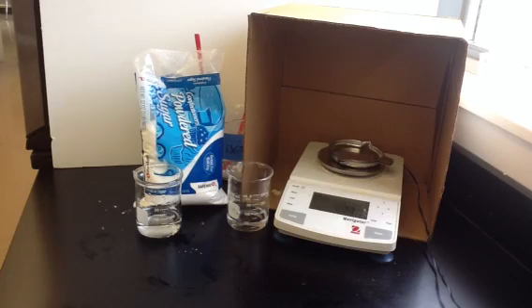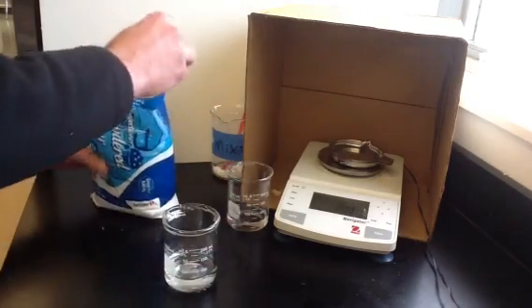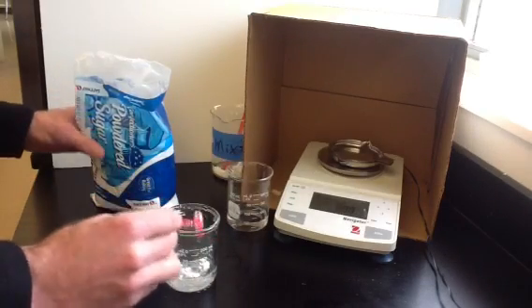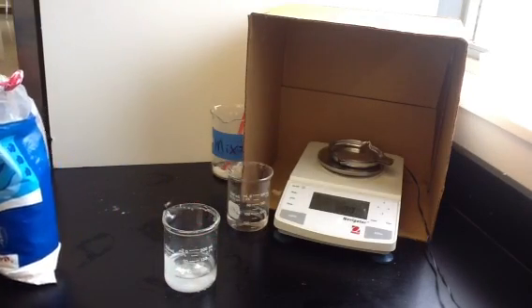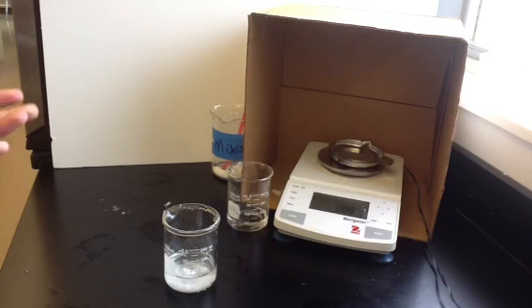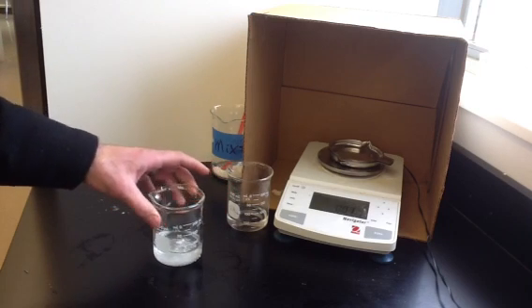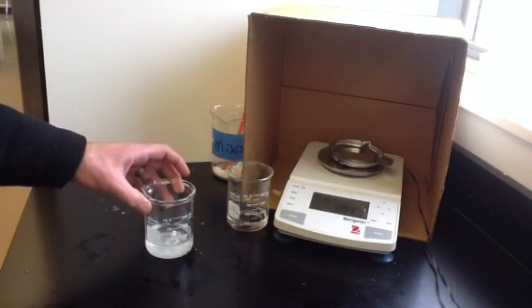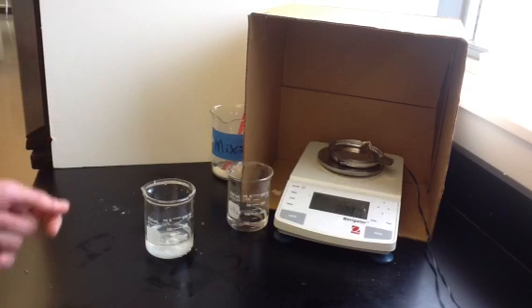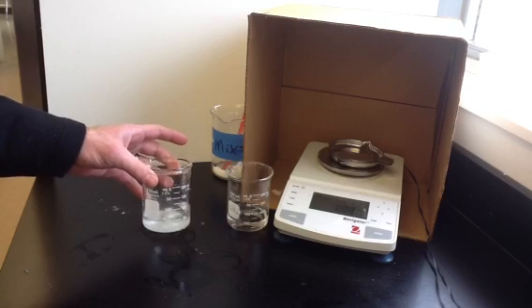The other substance in our mixture is powdered sugar. When sucrose reacts with acetic acid, nothing happens. You can see that it dissolves a little bit in the water, but no reaction takes place and no gases are released, so there won't be any change in mass. So if we start with 10 grams of sugar and acetic acid, we'll still have 10 grams of sugar and acetic acid at the end because no reaction took place.